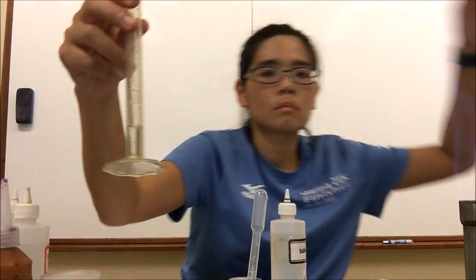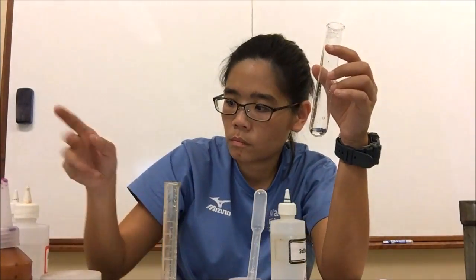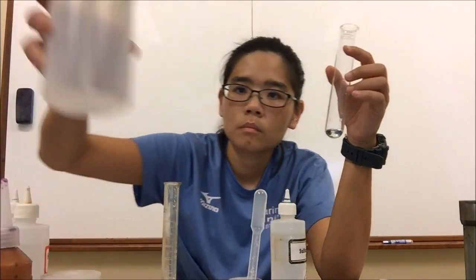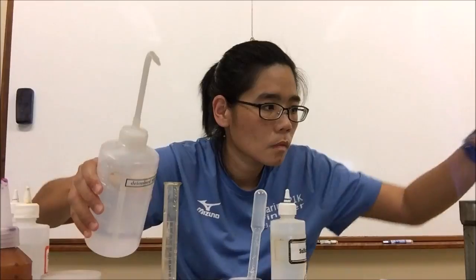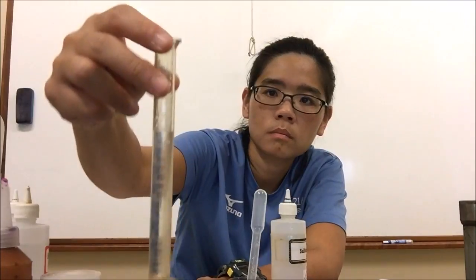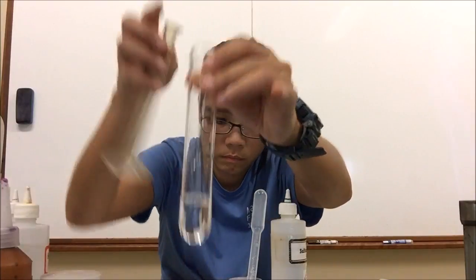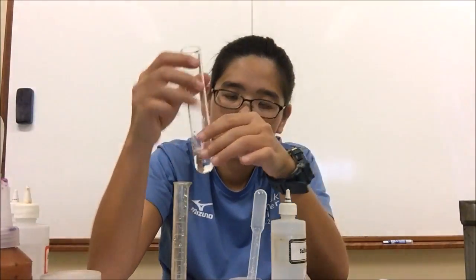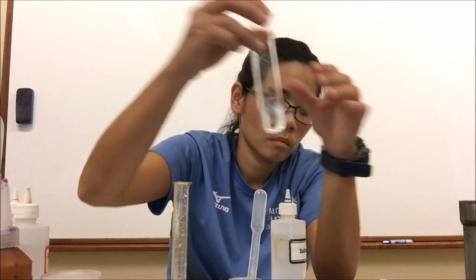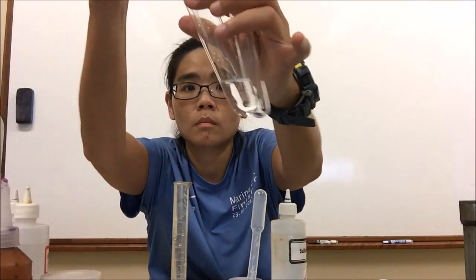I measure 8 cubic centimeters of deionized water using a measuring cylinder, so that together with the 2 cubic centimeters already in the boiling tube I have 10 cubic centimeters of solution. I shake to mix well. That gives us 10 cubic centimeters of dilute solution P, from which I will take 2 cubic centimeters for the next test. I leave the dropper inside the bottle to avoid contamination.